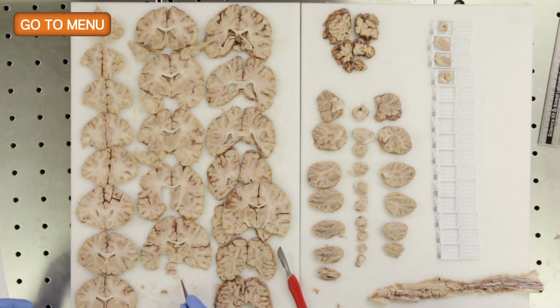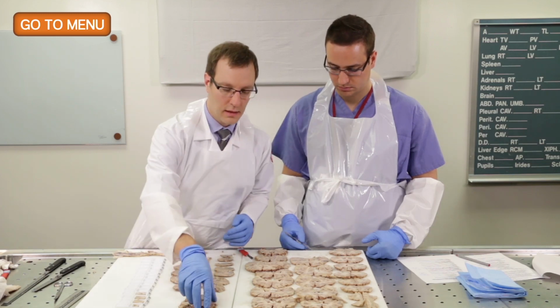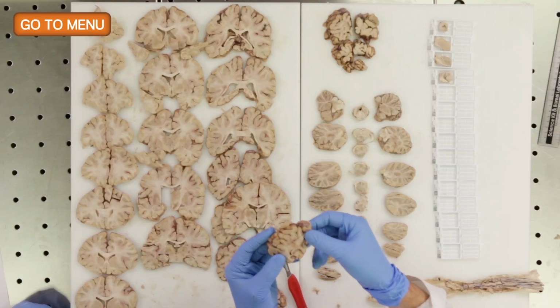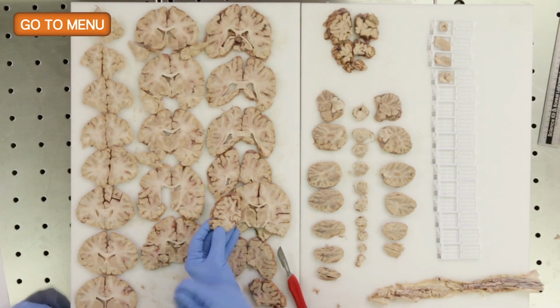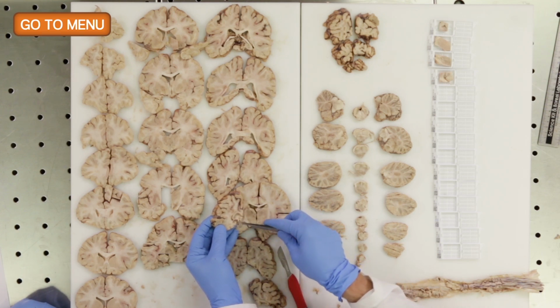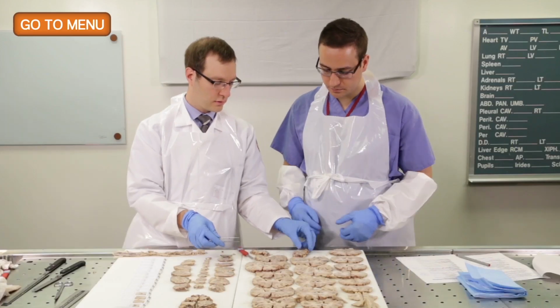So for the fifth section, we'll take an area in the occipital lobe, and we'll focus on striate cortex, where you see the line of Gennari in the primary visual cortex. So, for example, in this region we have the calcarine sulcus, and when you see it closer, there's actually a white line here. That's the line of Gennari. So we'll sample this area of the occipital cortex.